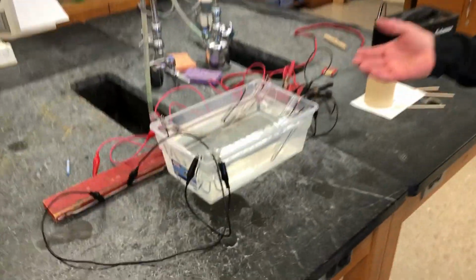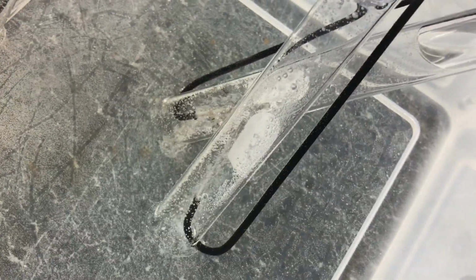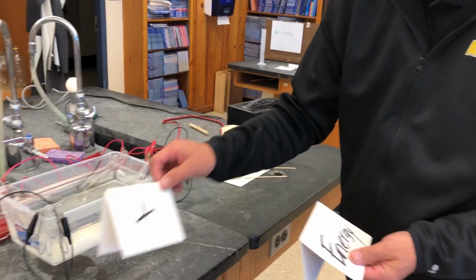This is part 3 of the Energy Reactions Lab. Now, if you recall from part 1, we were using electricity to separate water into its two components, hydrogen and oxygen. So here we have this equation, H2O. That is our reactant, but it's not our only reactant.